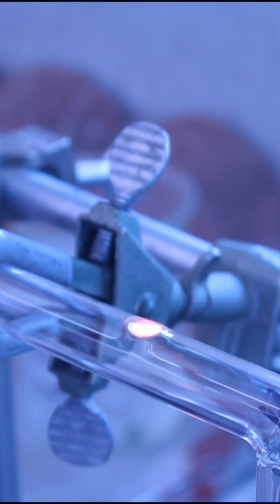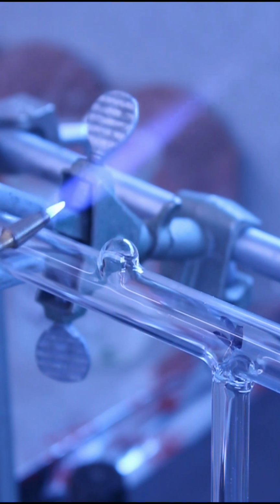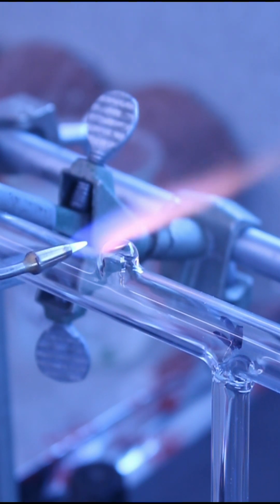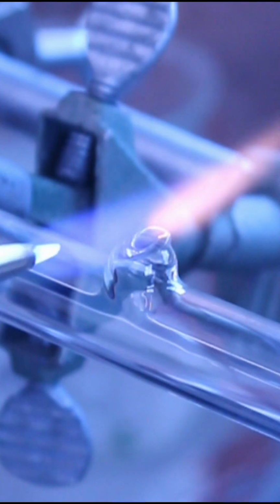Now this time, I blow it out much thinner. And I'm going to come right across the top. And as I was heating, I blew into it to pop out the hole.